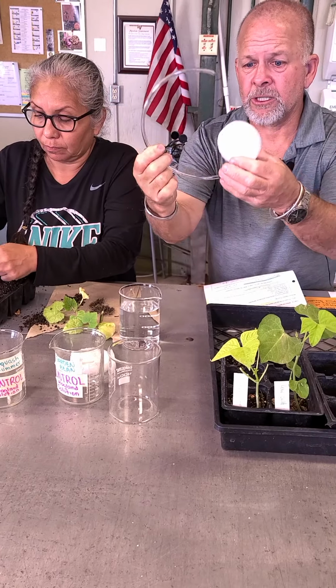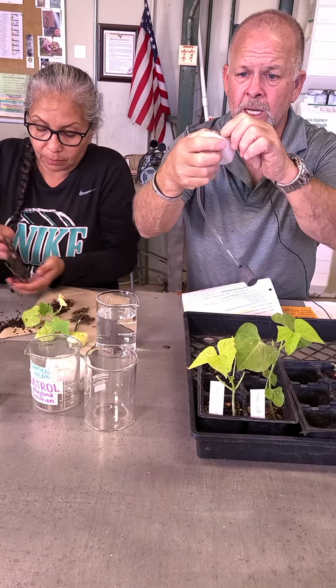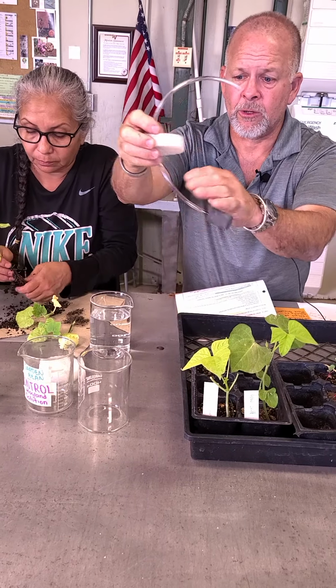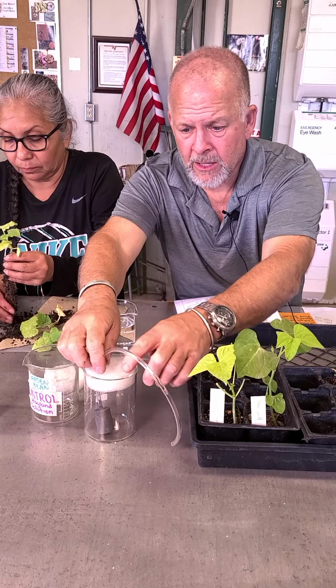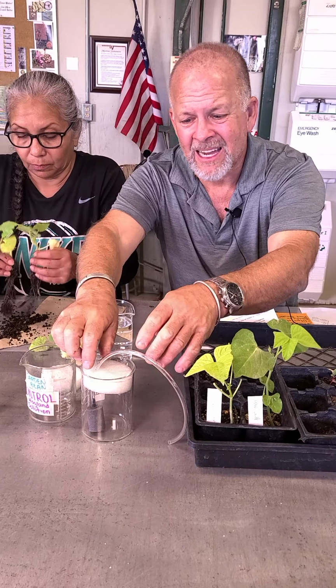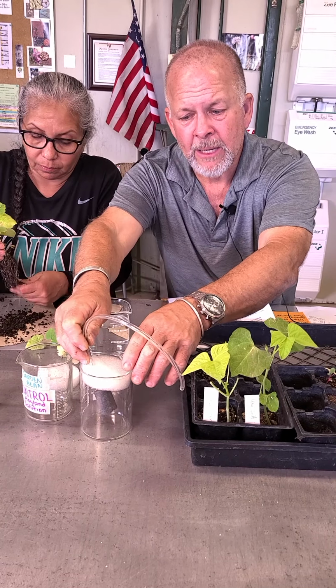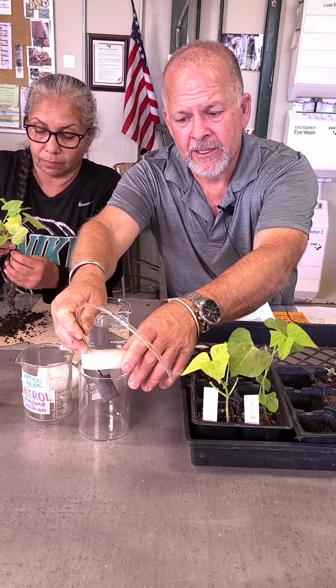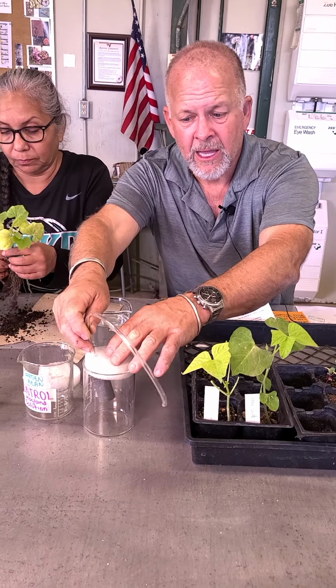So we needed this air stone to provide all the bubbles, and we realized that we got to have the air stone go through this like this, and then we had to have another opening here because it's foam and it makes not a really strong seal, but a seal that's strong enough that we would end up getting a lot of pressure underneath there, and these things would float out. It'd be the pressure on the plants, it wasn't a tight seal, and they would float out.